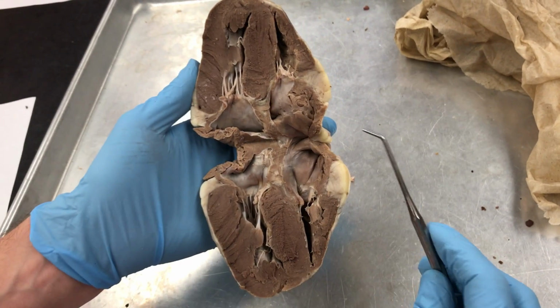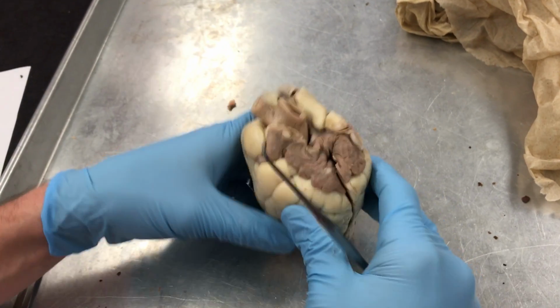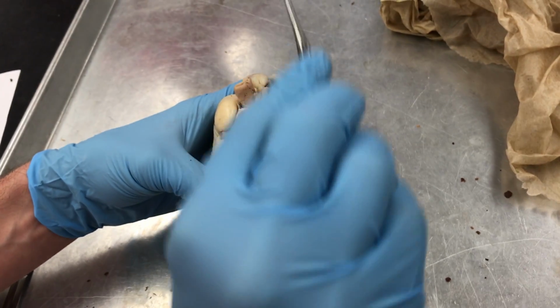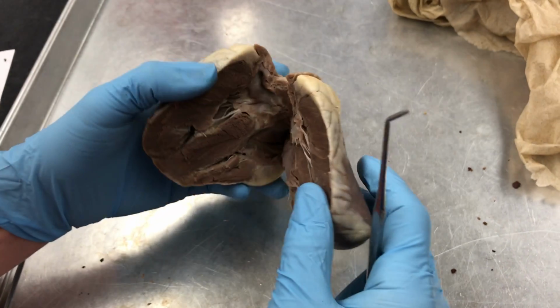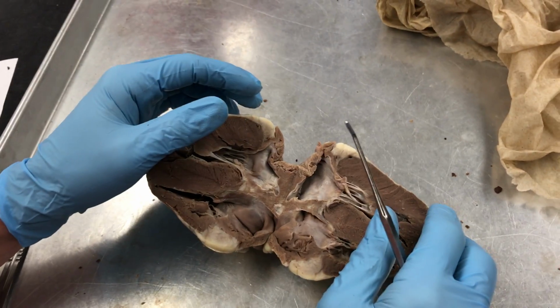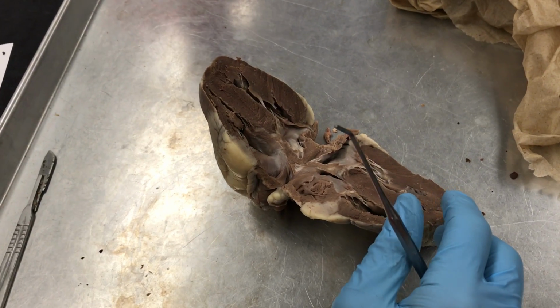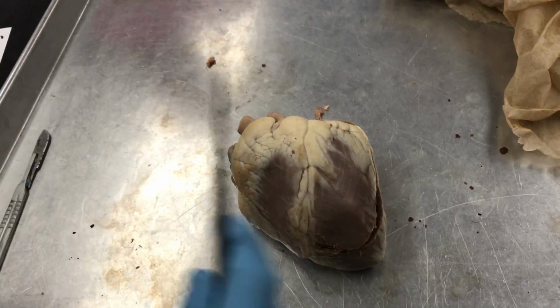Do we need to know the common carotid artery and the subclavian? It's not on here. They would be like here. So this is everything I think. Do we have an actual list? No, just this. Just this. Okay, so yeah, aorta. Oh, I mean, some of this we already pointed out.